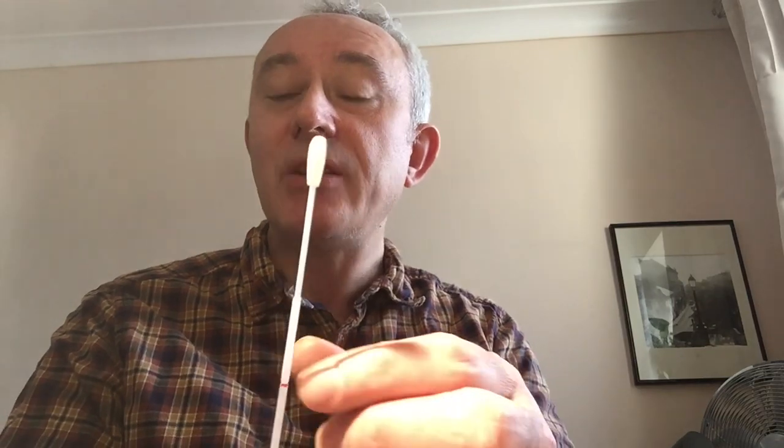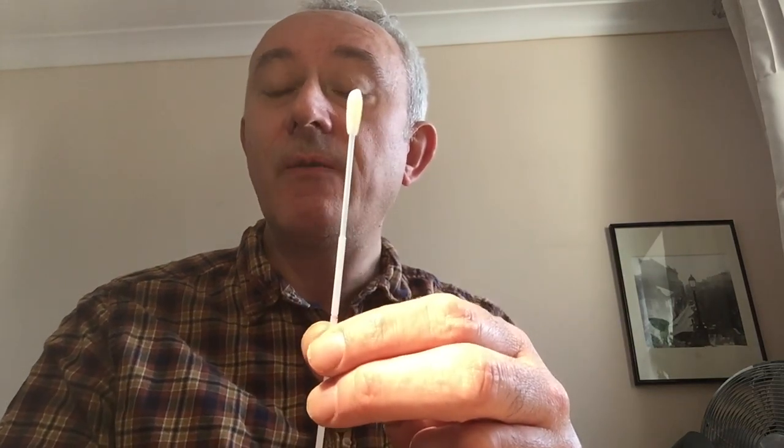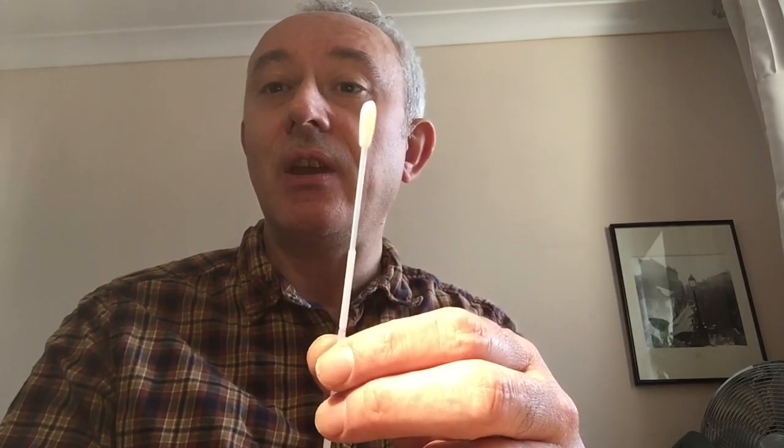So for example, what I'm going to use is the common swab. Now a swab might look simple — you might think it's a piece of cotton, or in this case nylon, on the end of an applicator stick. But actually the swab is quite an important device in the microbiologist's toolkit.